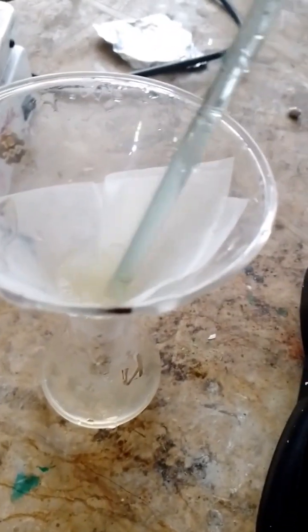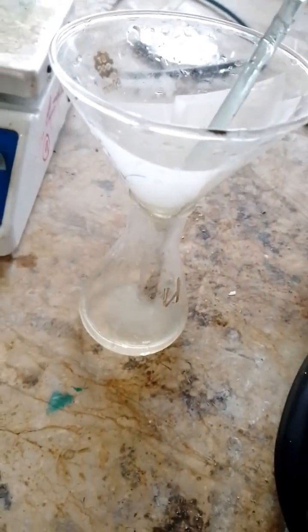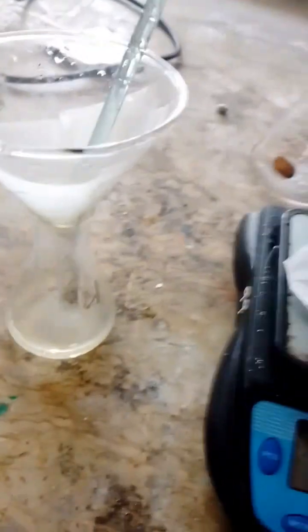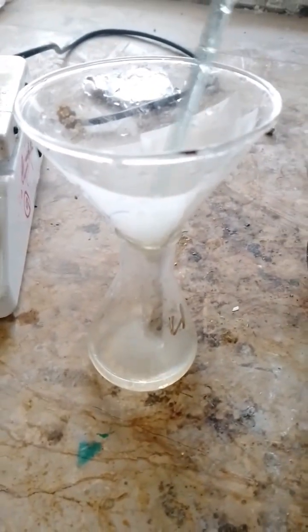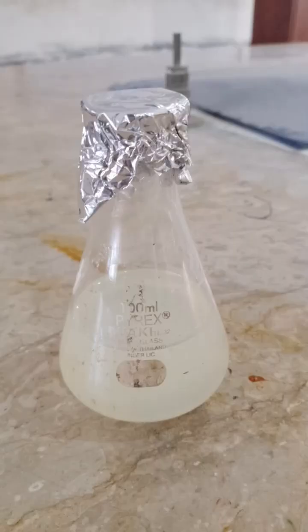Filter it until the residue remains on the upper side of the paper and liquid flows out. Hence, by this method, you will obtain an extract which actually contains the reducing and capping agent. Thank you so much.